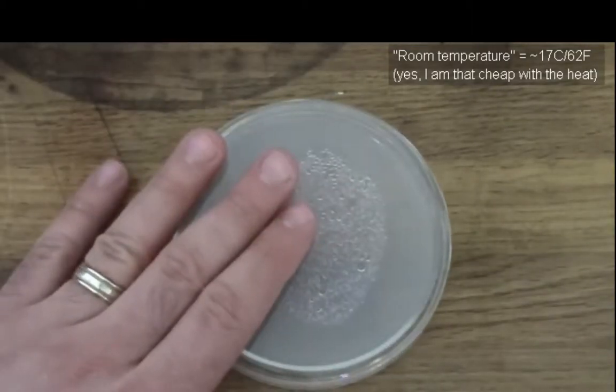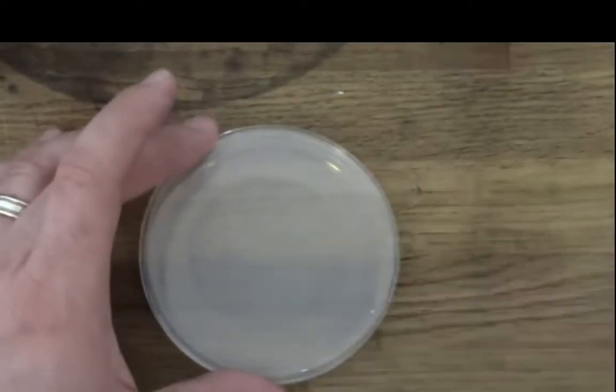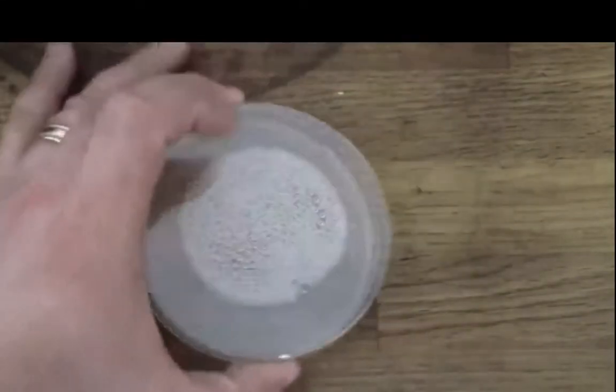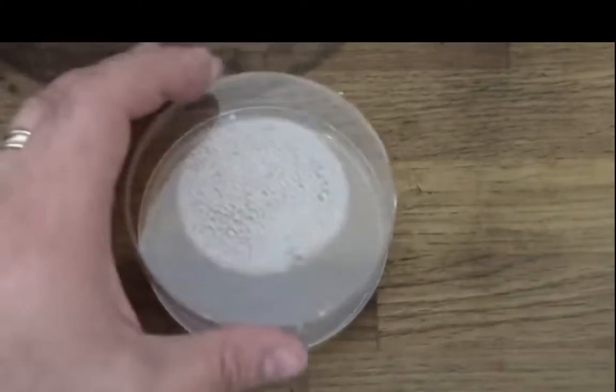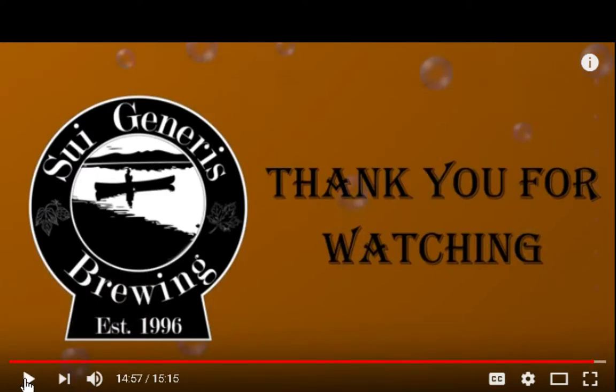And this is 6 days at room temperature since casting the plate. And again, here is the wort agar plate, and you can see both from the bottom as well as from the top that there is no noticeable growth, despite the fact that these are over a week old. So anyway, that's the story with that.